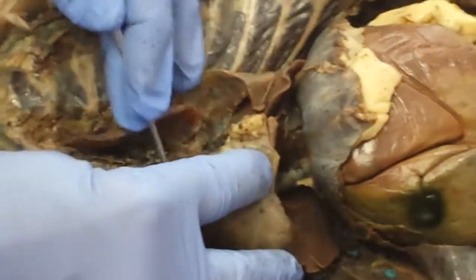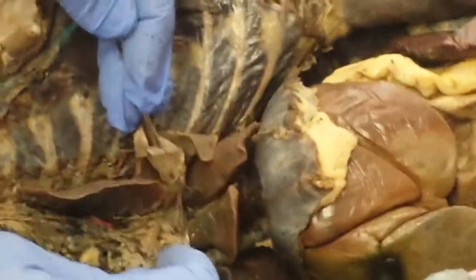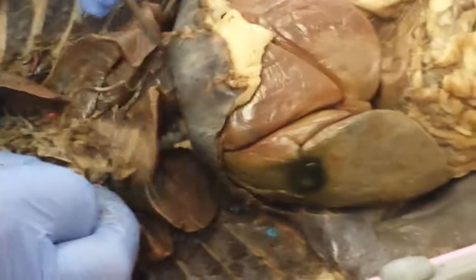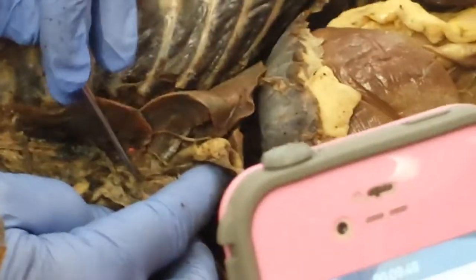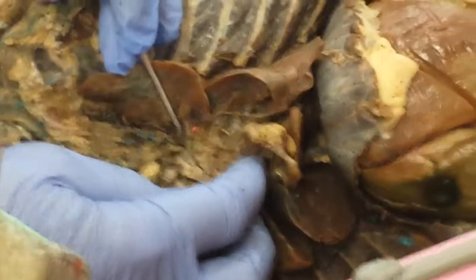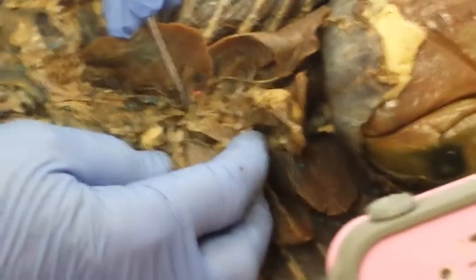So then the blood passes from the pulmonary trunk through the lungs, comes back to the left atrium via pulmonary veins. So I would imagine right in this area right here would probably be a couple of the pulmonary veins coming back to the left atrium. So now oxygenated blood is coming back from the right and left lungs through the pulmonary veins into the left atrium.